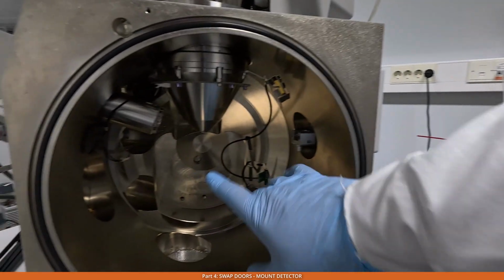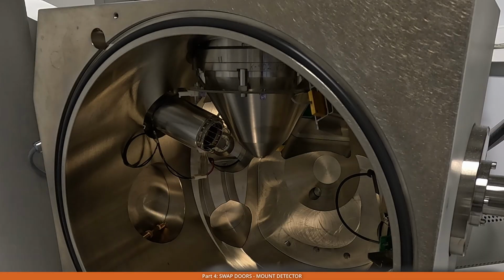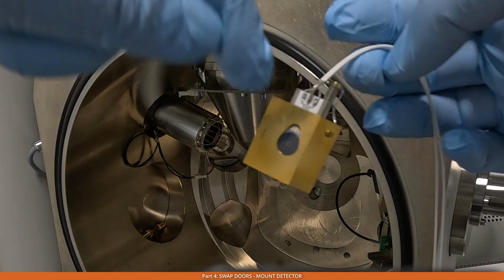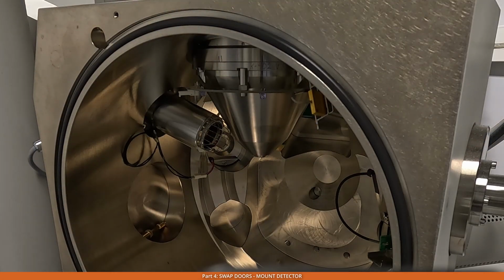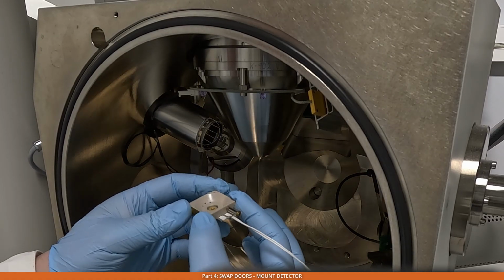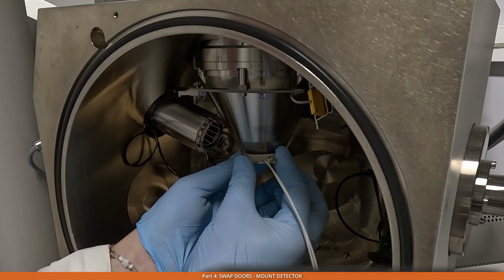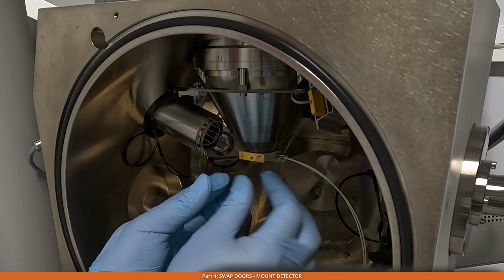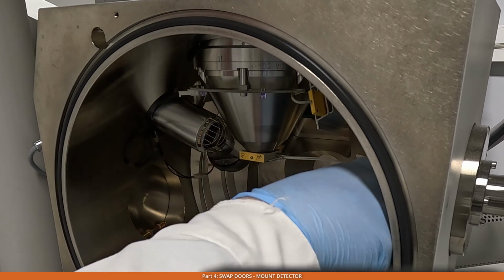Okay, and the detector is mounted here under the pole piece of the microscope. Let's mount it now. One needs to be very careful, because there are very fine wires here at the top that connect to the detector itself. So what we do, we take it the proper way, bring it through at the corners here, like this, and then we bring it under the chamber, under the pole piece, and then we slightly pull it over. I usually do a slight tilt in the anti-clockwise direction. And then we connect this cable into the proper socket here.